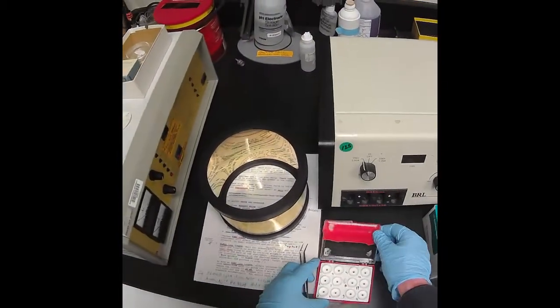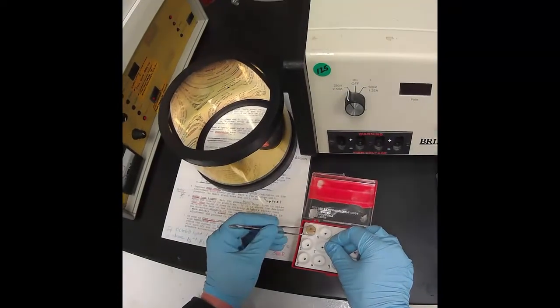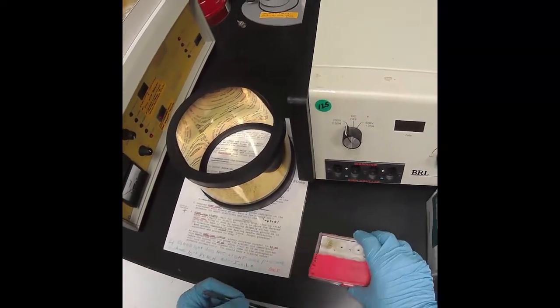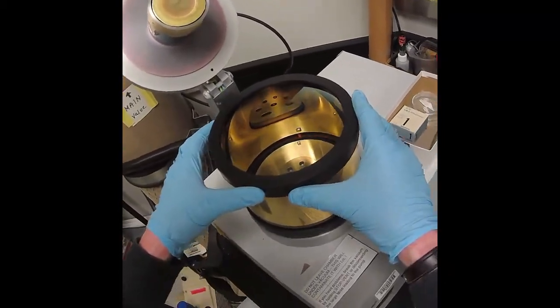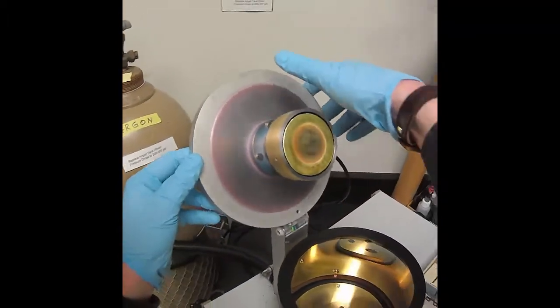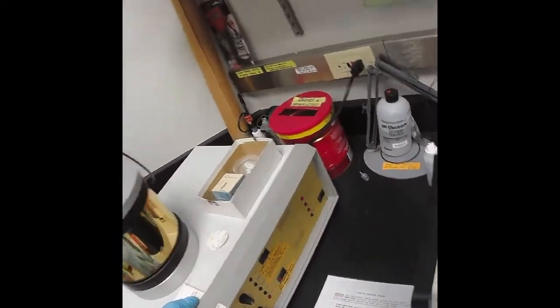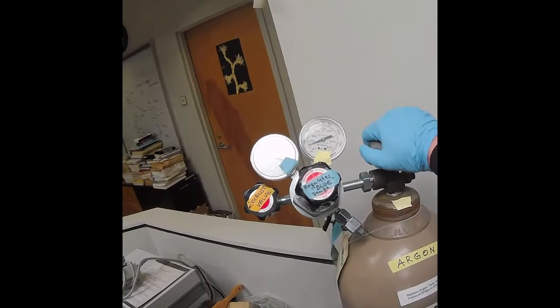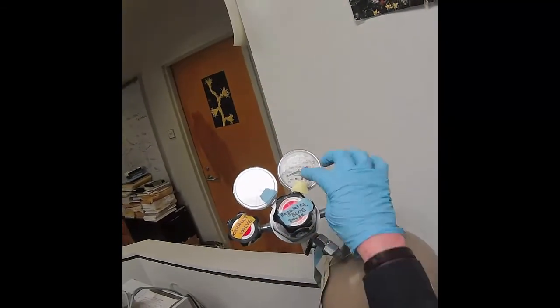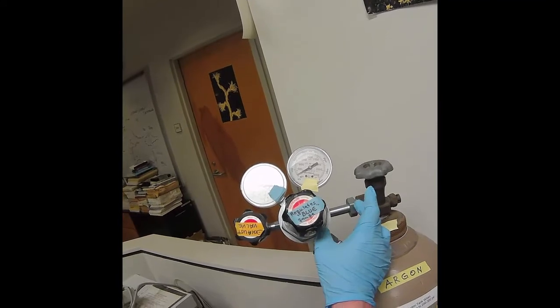We'll place our sample into this sample holder tray, noting our tray position so we can share the box with other users. Put the chamber back together. Again, no dust or grease. Rest it closed there and turn off the power. Close the main argon tank valve. Then there's still argon pressure in here, so open the exhaust valve to bleed this little part and the regulator.